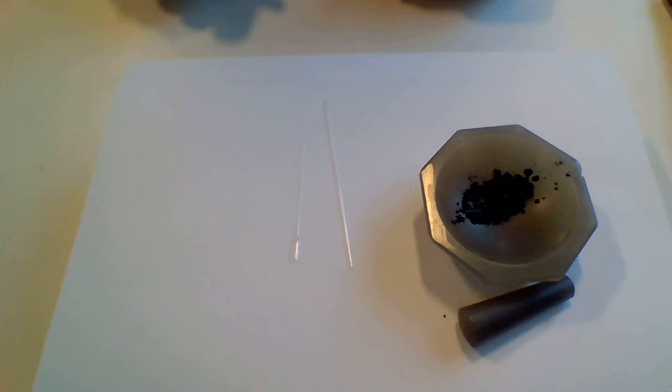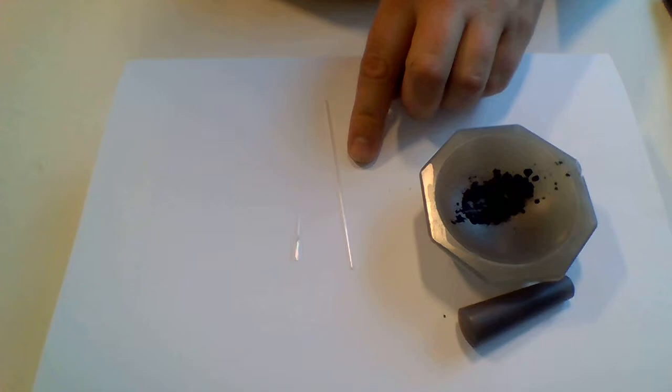In this presentation I will show you how to mount a sample in a capillary. Here I have the very thin capillary and I have a tube that is normally used for determining the melting point.